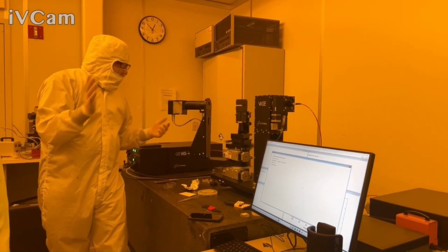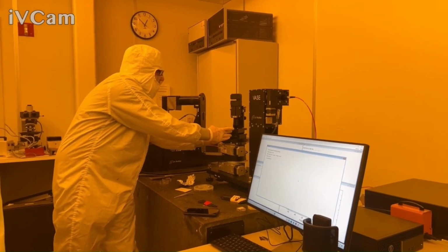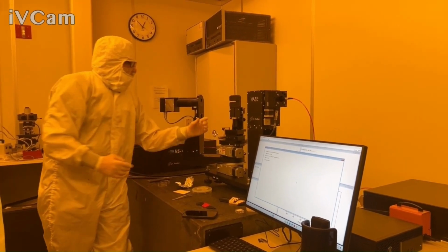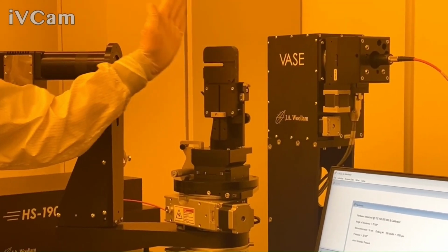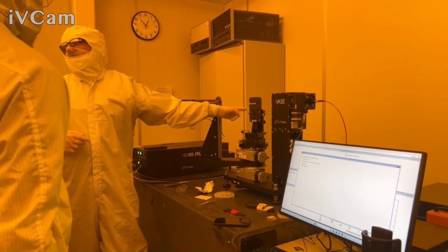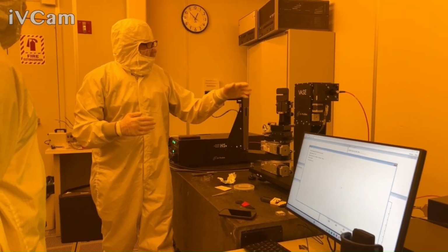That's why, if we're doing transmission, I might put some kind of a spacer here to get the stage out of the way. That works in transmission because it doesn't matter how close the sample is, as long as it's aligned. Obviously, you don't want to align your tip tilt back here. You want to align your tip tilt before you push it back.